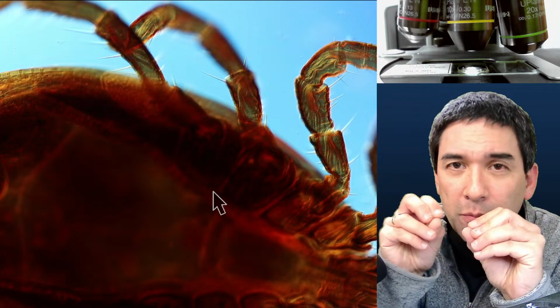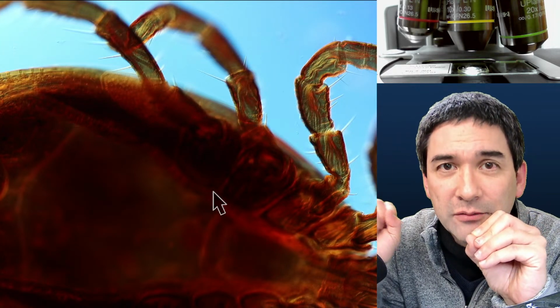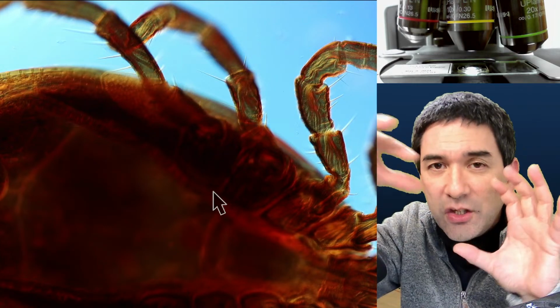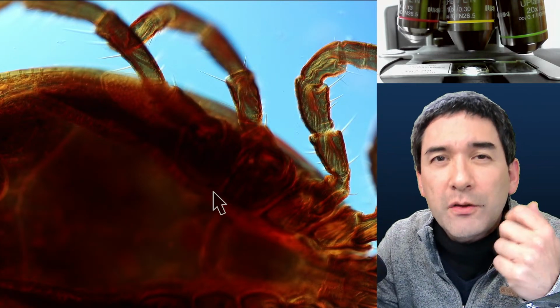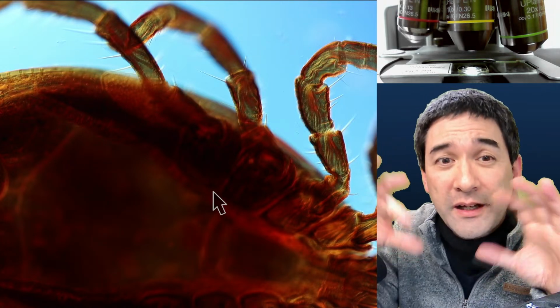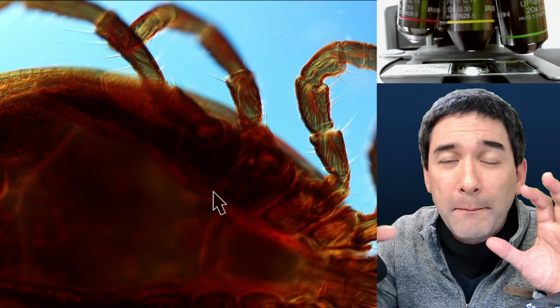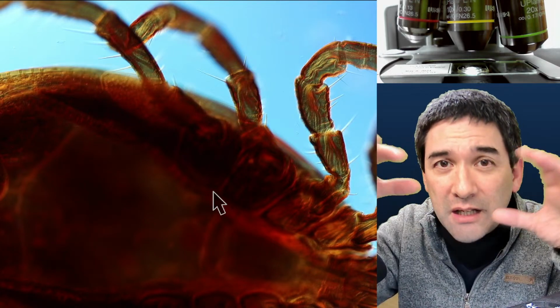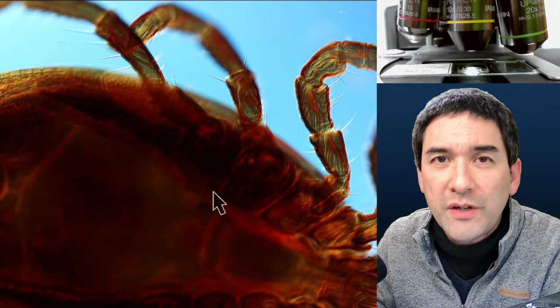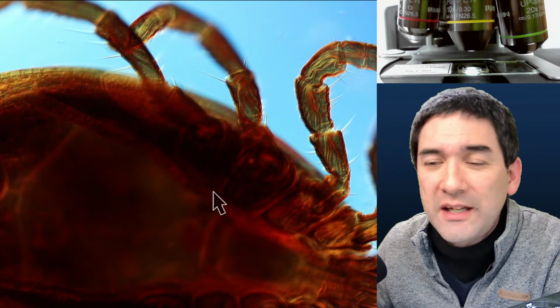And at the bottom of these so-called ommatidia, you have light-sensitive cells. So the insect will get an almost 360-degree view, but not as clear as what we humans have. For that reason they're only able to see basic shapes, but they get very good coverage. That's why it's difficult to catch insects, because they're actually seeing what comes from behind.